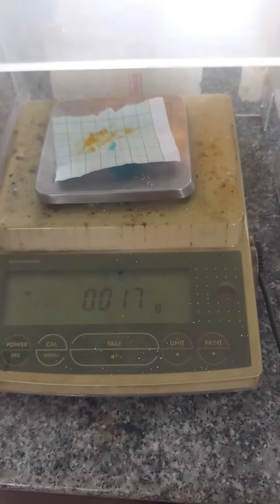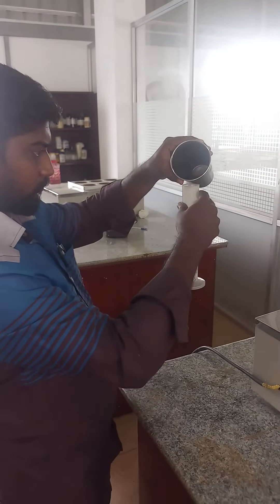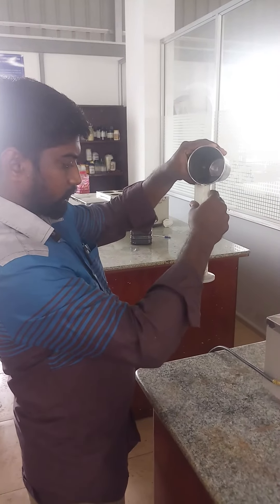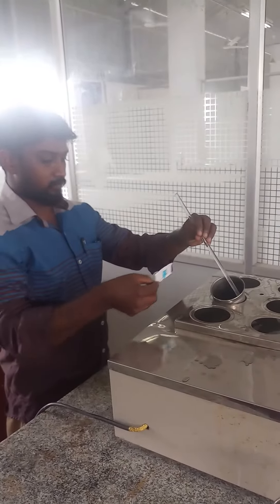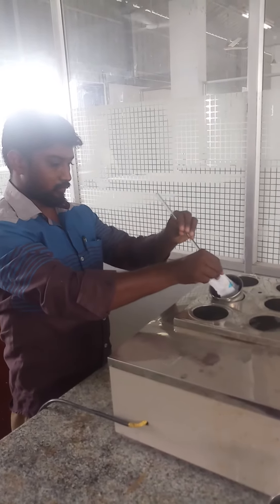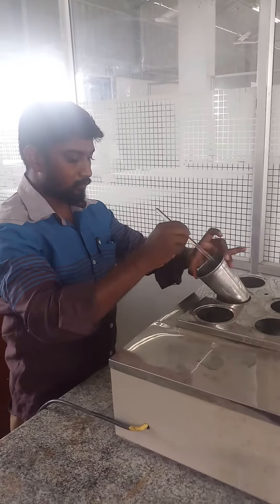0.017 grams of dispersed dye has been taken. 43 ml of water has to be taken. The required amount of dye has to be added to the dye bath and it should be stirred well.